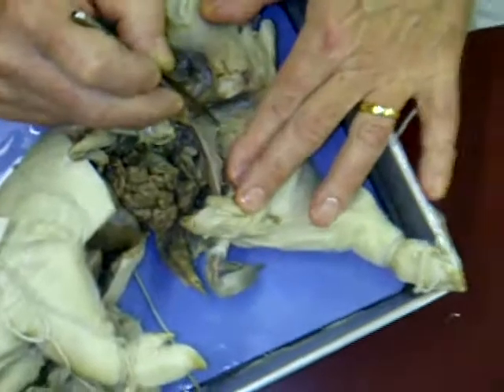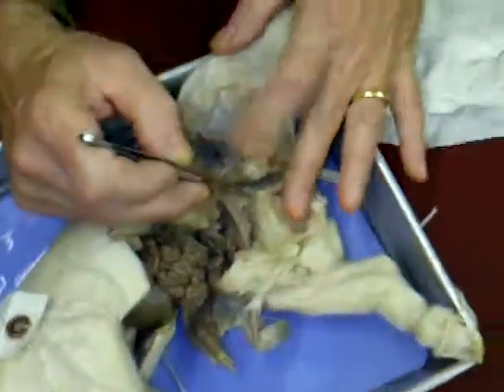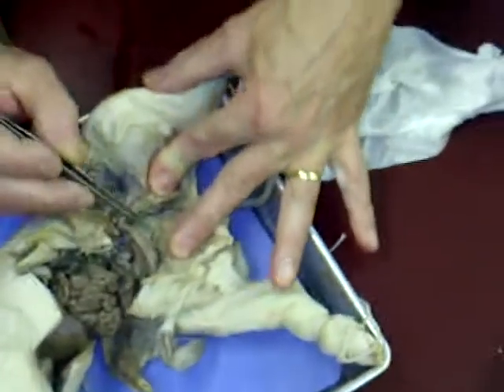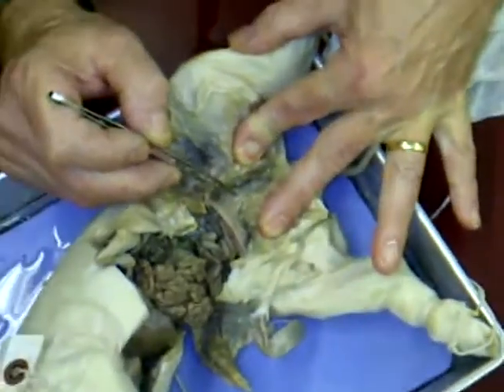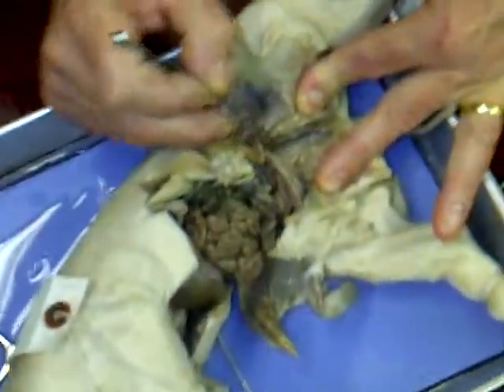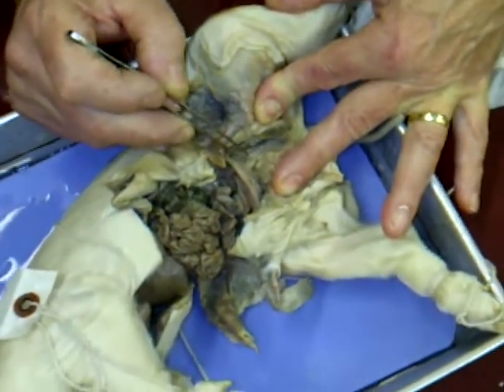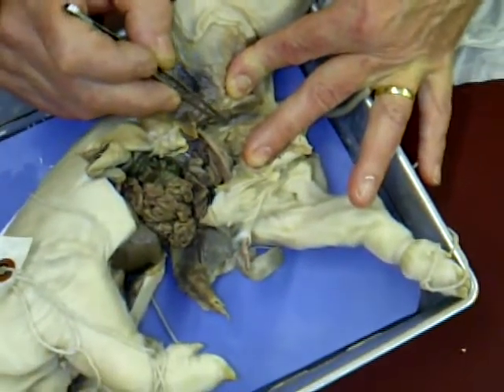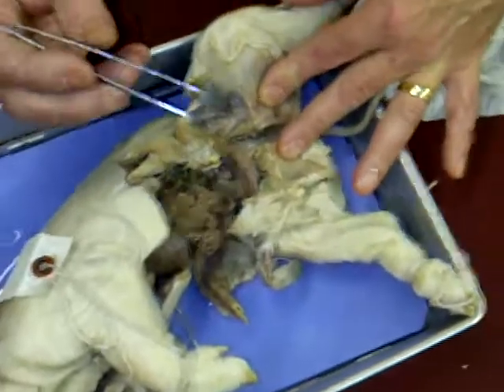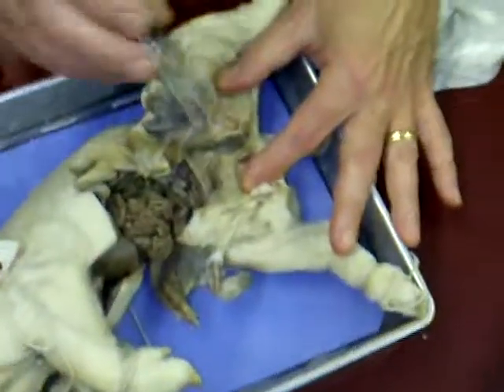So you actually have, as you look down here, you have basically kind of three pipes going down. You have in front you have urethra, and then behind it the vagina, and then behind that you have the colon coming down, right? So you have an advantage if you're a girl. If you want to remember the order of those pipes, all you have to do is look down, and then the openings are the same as they are in your body, because you're mammals too.